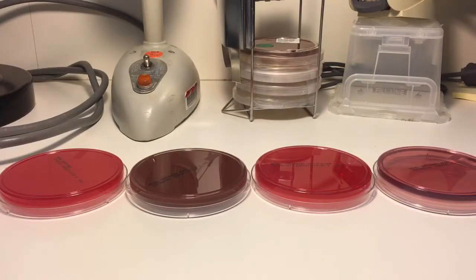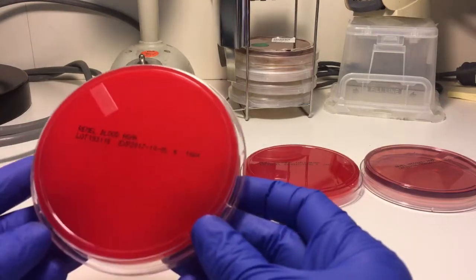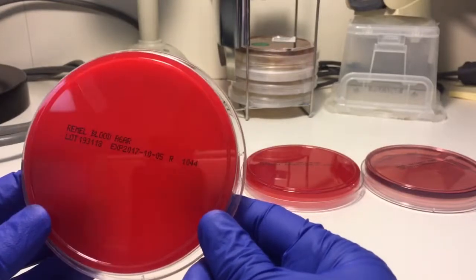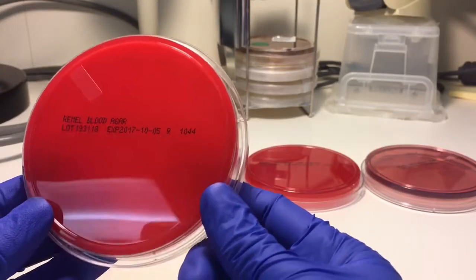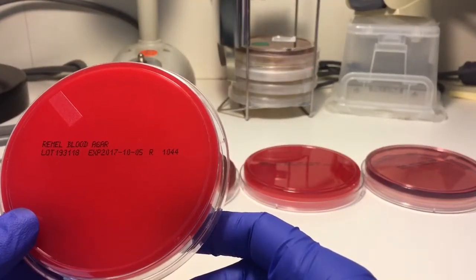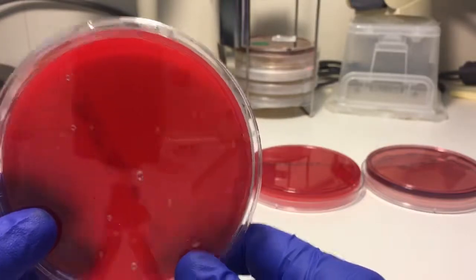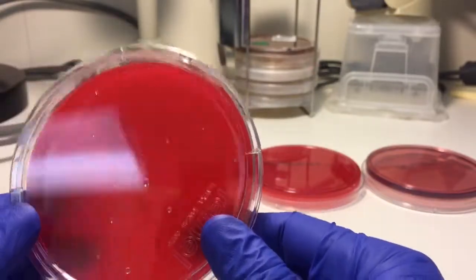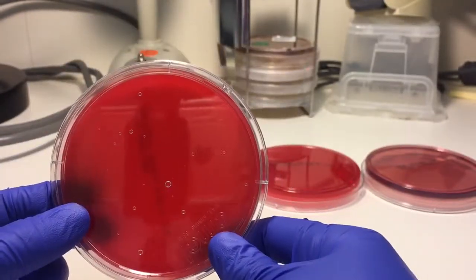These are the four plates I want to talk about. The brand we use is Remel — not an endorsement, just what we use. The first is the blood agar plate — 5% sheep blood agar — used as both an enriched and differential media. We use it to differentiate beta hemolytic colonies from non-hemolytic ones, and you can also see alpha hemolytic colonies. It's a general all-purpose plate that grows both gram positive and gram negative organisms.